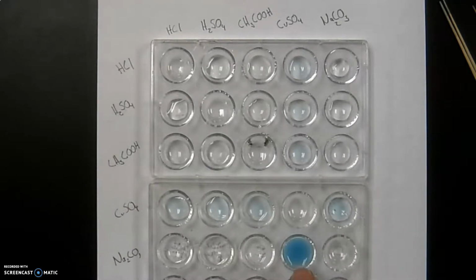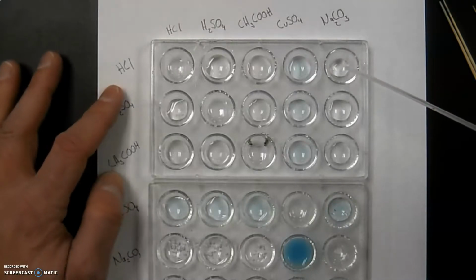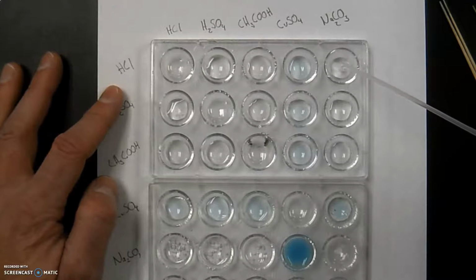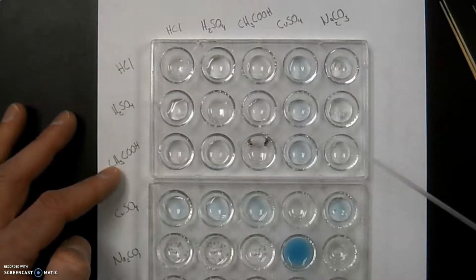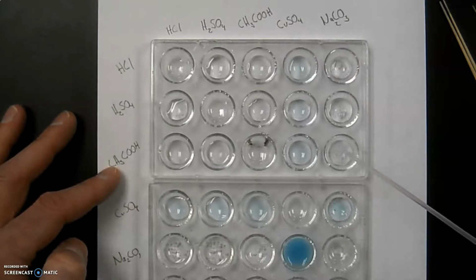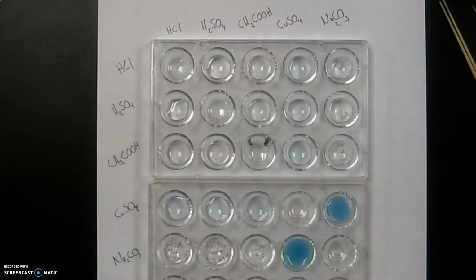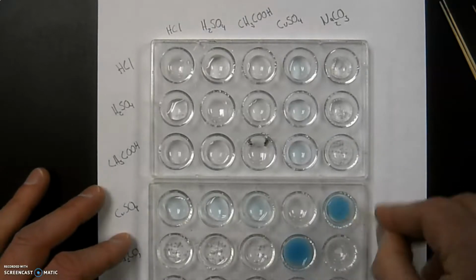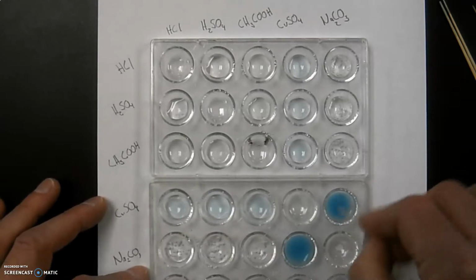Looks like something is going on there. That does look different. So that's the sodium carbonate and the copper sulfate. So that's interesting. And then the last one in this column over here is the sodium carbonate. So you may see different levels of reaction going on as well, really kind of based upon who they are. So again, these two guys are the same. You're going to have some duplicates in here, so just be aware of that.